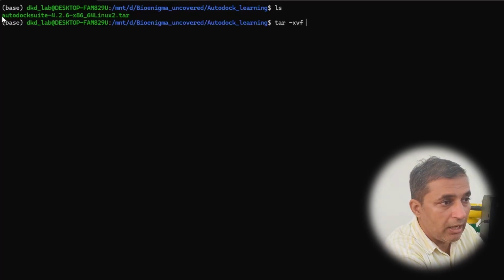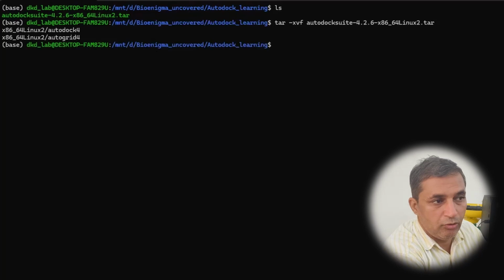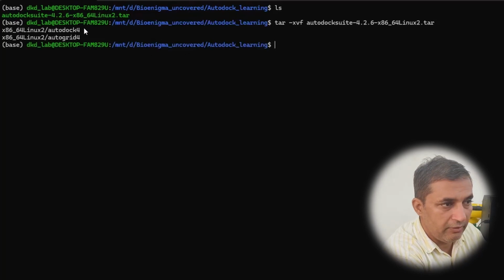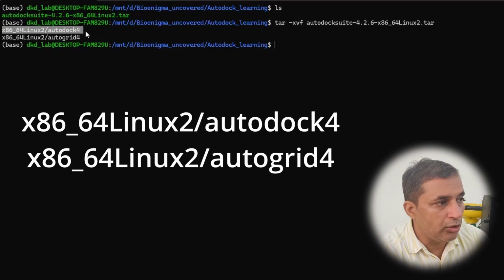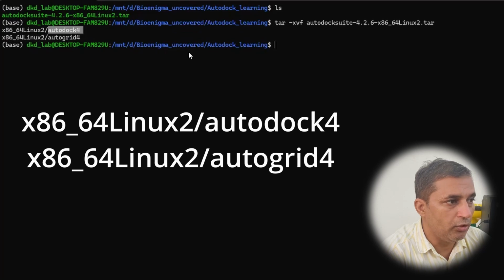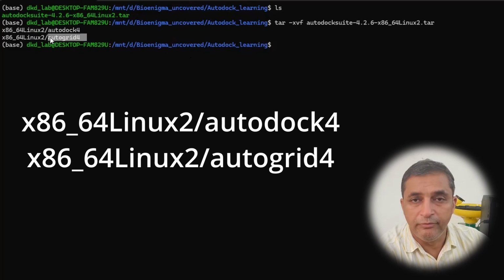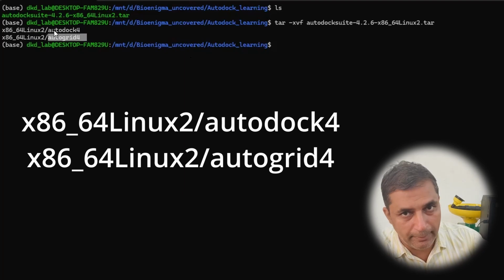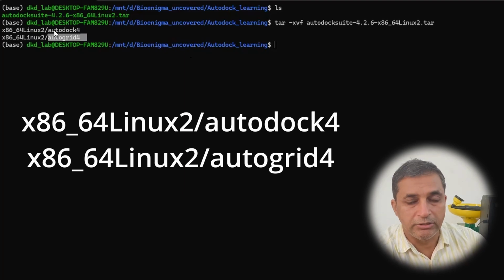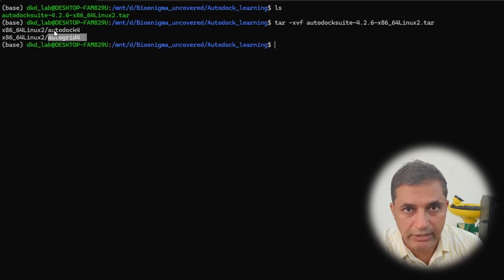So I'm going to type the command tar space dash xvf, and once I type this, I'm going to copy the file name and paste it here right after the xvf, and then hit the enter button. Once I hit the enter button, I will get 2 files in another subfolder within this AutoDock underscore learning. The first folder contains the AutoDock 4, which is the main docking file, and the second one is the AutoGrid 4. This is going to map the grids during the docking process. You can basically consider both these files as the heart of the docking process.